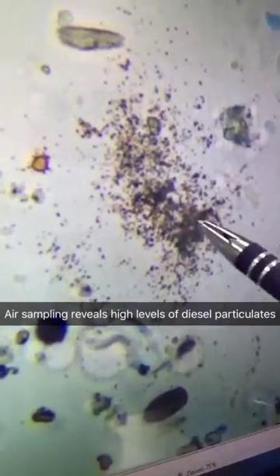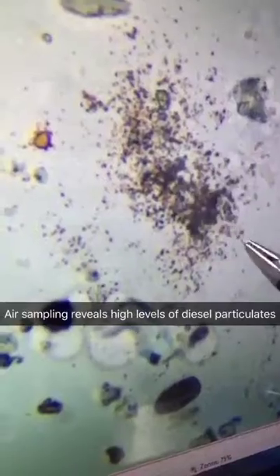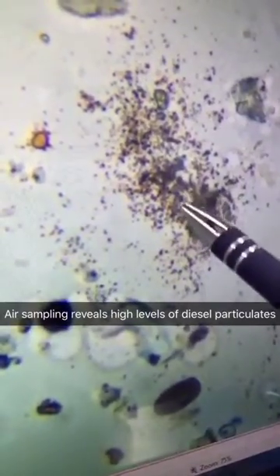This is another sample from a bedroom at this property and here's an excellent example of airborne diesel particulates in this bedroom.